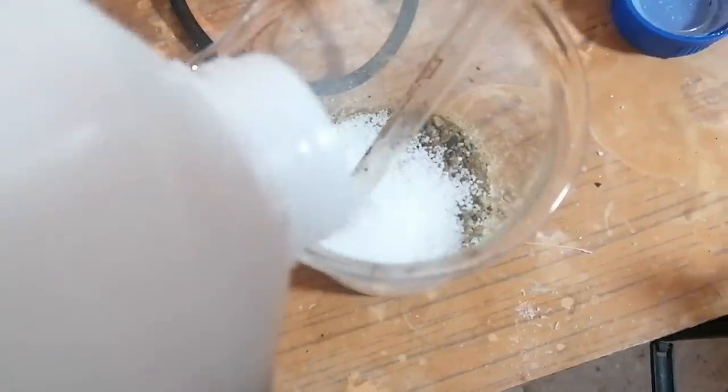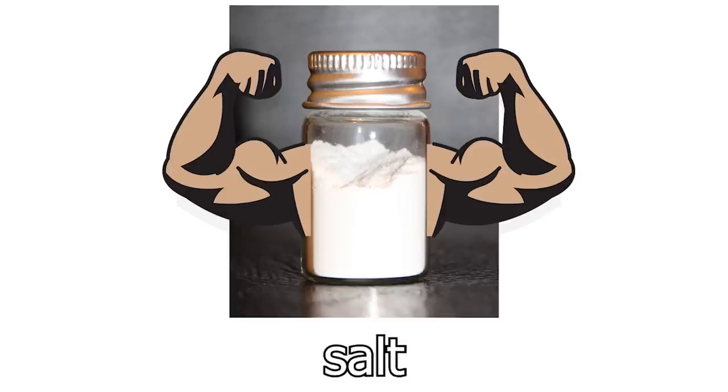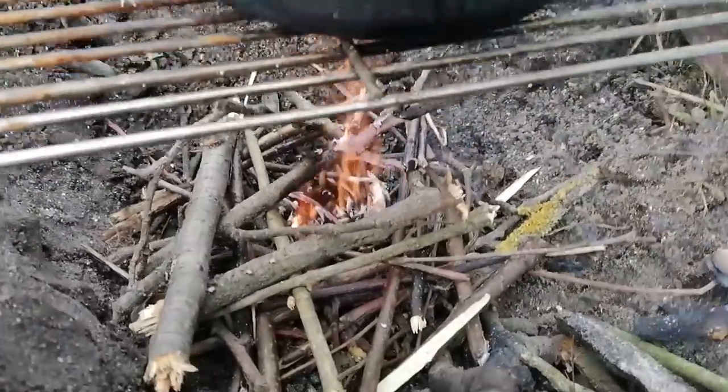There's still a bunch of contaminants in the mixture, so I started adding a bunch of sodium hydroxide beads to it, which is a really strong base, and it will convert silica into a water-soluble form. The reason why I didn't dissolve the sodium hydroxide in water is because silica is such a resilient salt that neither aqueous bases nor most acids can hurt it. So I've put it all into a pot and started heating it on a campfire.